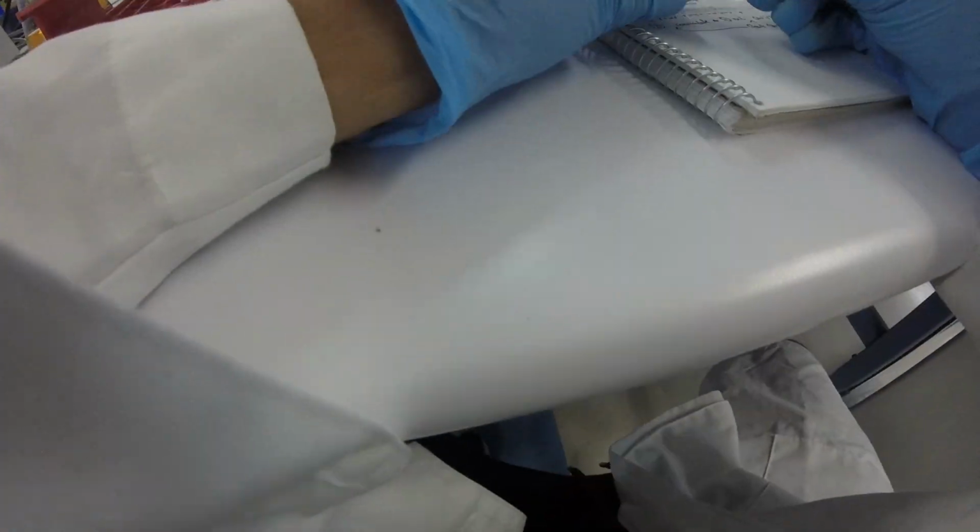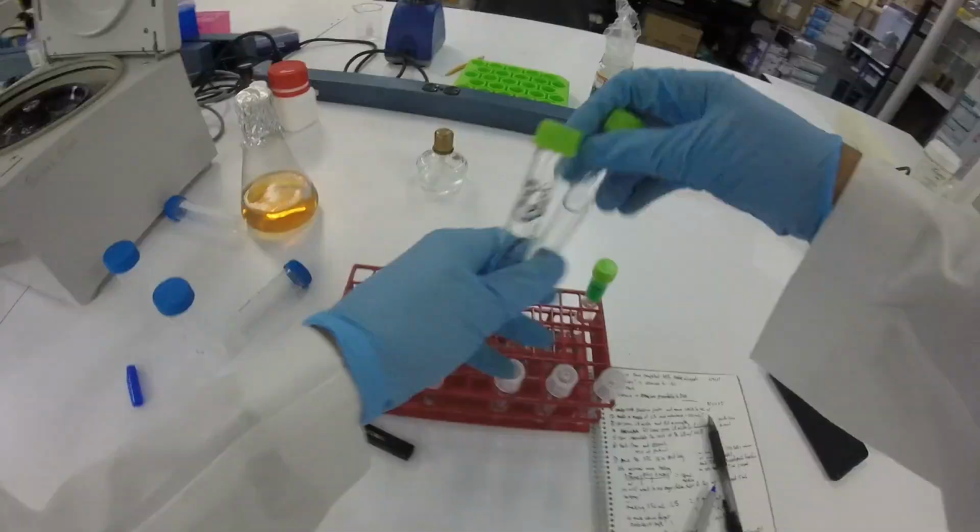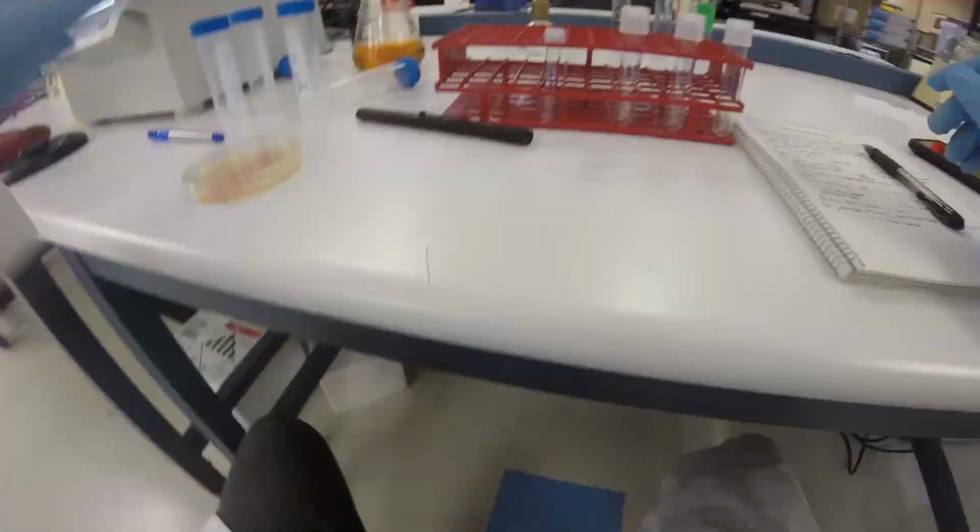But anyways, this got me thinking that this is one of those things I bet biologists have to do all the time, just in a lab where they're babysitting this stuff. Let me explain the experimental setup, because I feel like that's important context.